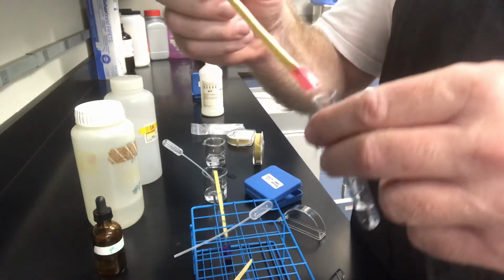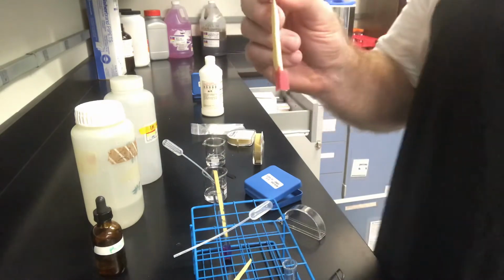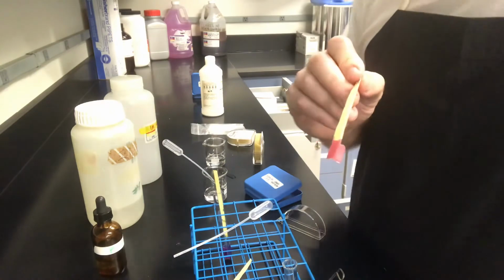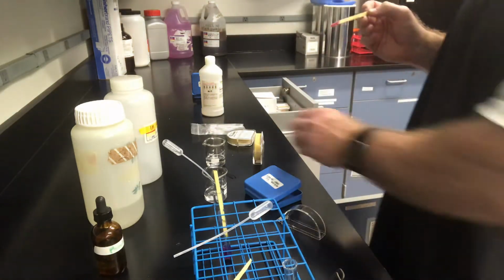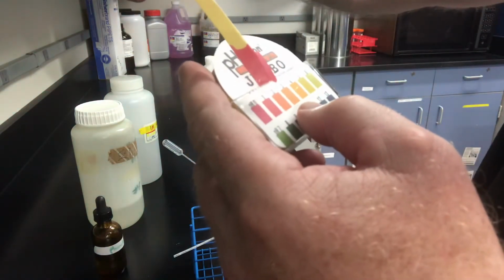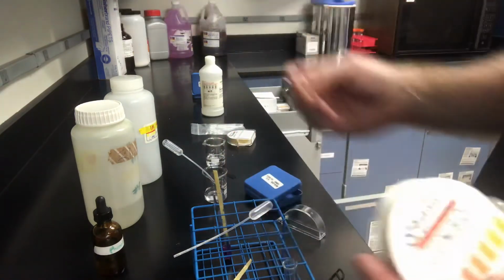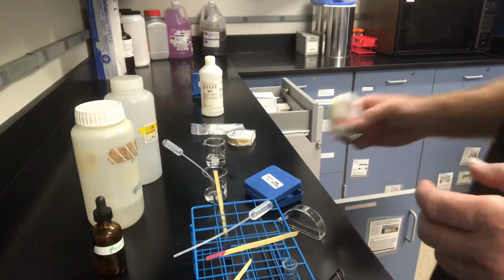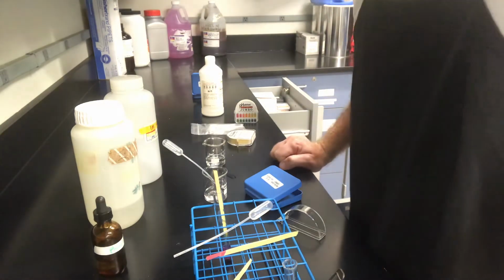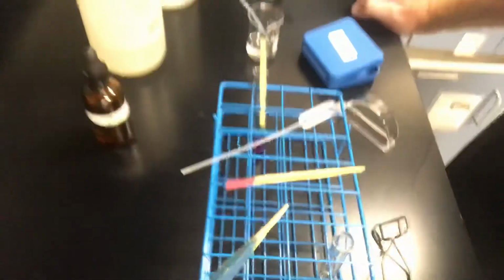Okay, here's the acid. We can see how pink that is. And here's the indicator. When I was in chemistry, we used to say red acid, blue base. Very easy to remember. All right, so if we check out the pH on this one, we've got a pH right down there around 1. Maybe you might argue it's 0. I don't know if you can see that. Yeah, about 1. So that is extremely acidic stuff because it's a strong acid. All right, and we have a strong base, and that makes that very bright blue. So you can see that. We got some sweet color there on the indicators.